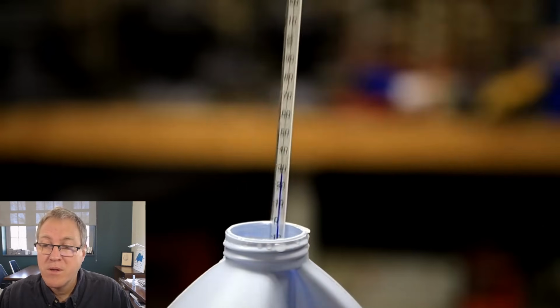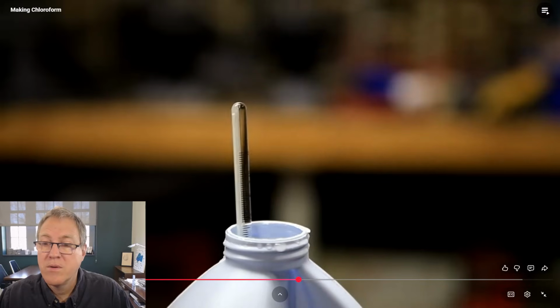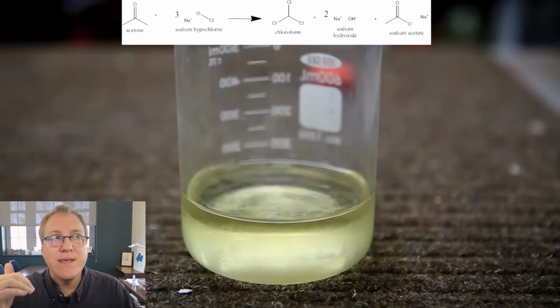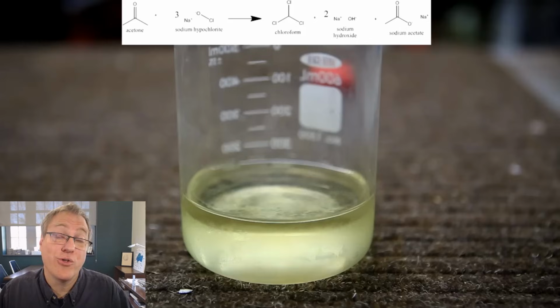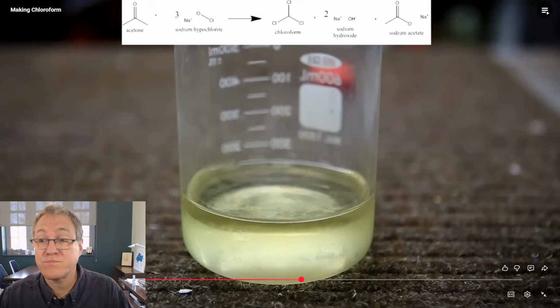After 5 minutes, the temperature is already at around 30 degrees Celsius. The temperature peaked at around 45 degrees Celsius. So this reaction, he started this at -2 Celsius, so it was pretty darn cold. And then he added the acetone, shook it a little bit, too little in my opinion. And then within minutes, it got up to 30 degrees and peaked at 45. If I had been shaking that and I really mixed things super well, then maybe the temperature spike would have been higher and that might have been a bad thing. So, he is following someone else's procedure after all.